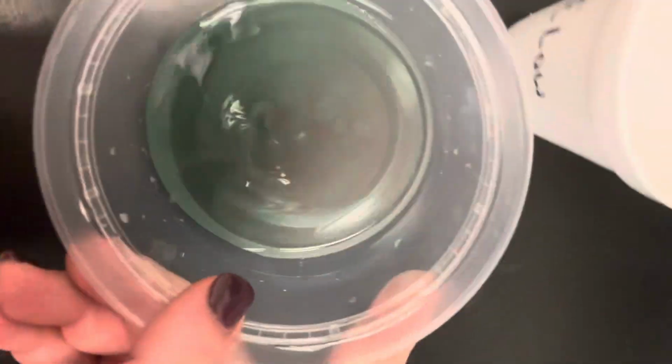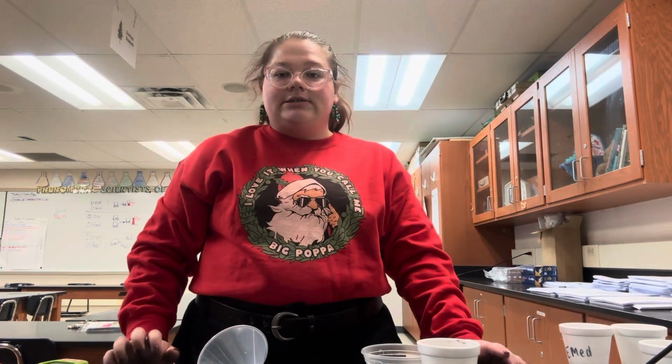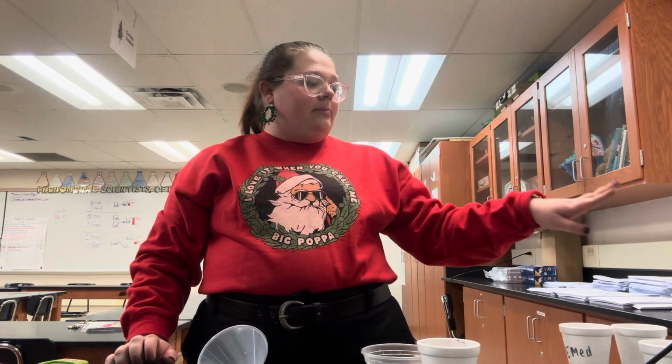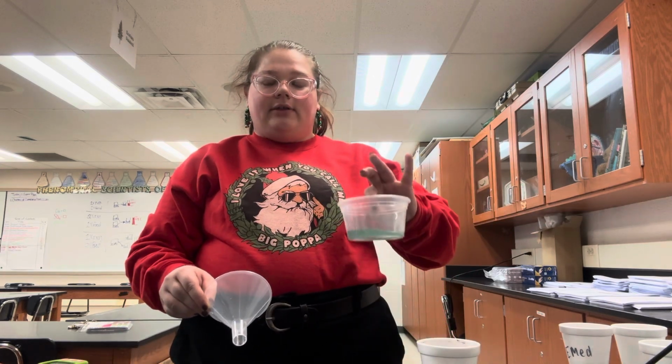And then we notice our liquid. And it has this bluish tint to it. That's the wrong way. Sorry if I was upside down. Okay, so write down the observations that you have from both what is inside the coffee filter and what is inside the liquid.